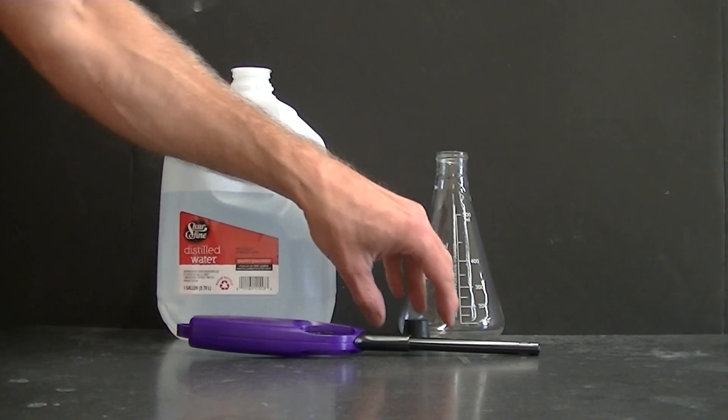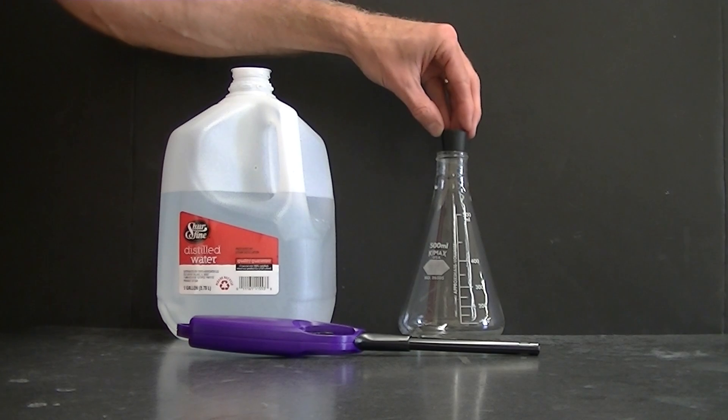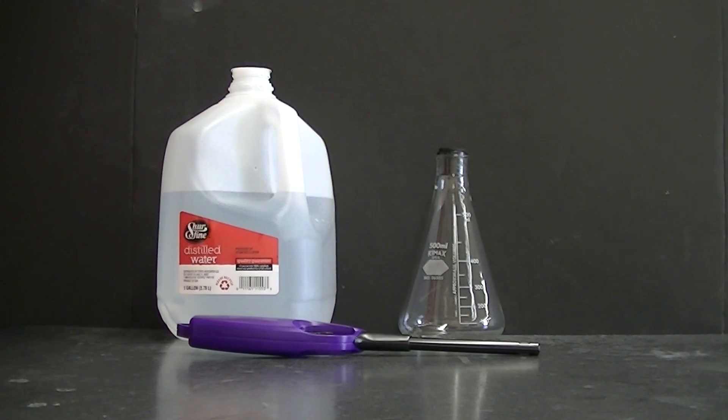Now because that liquid is going to be evaporating pretty easily, I'm going to stopper it and I can just leave that stoppered flask as is until I'm ready to do the experiment for the audience.